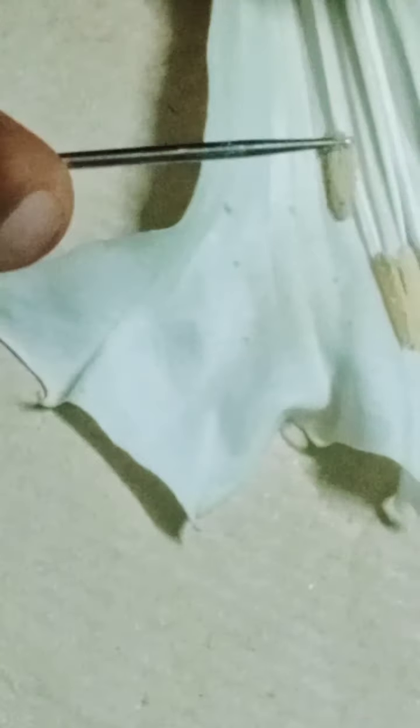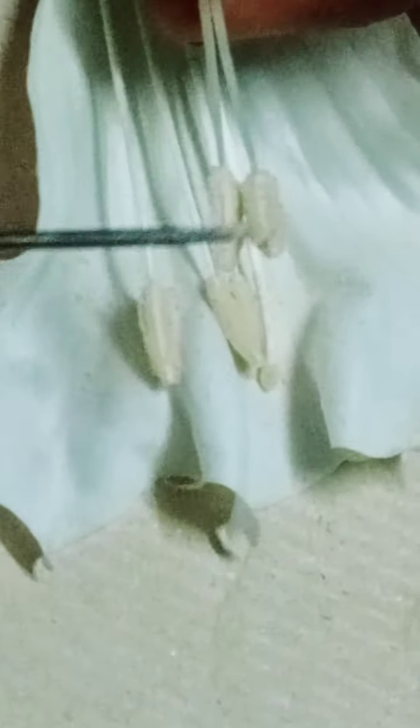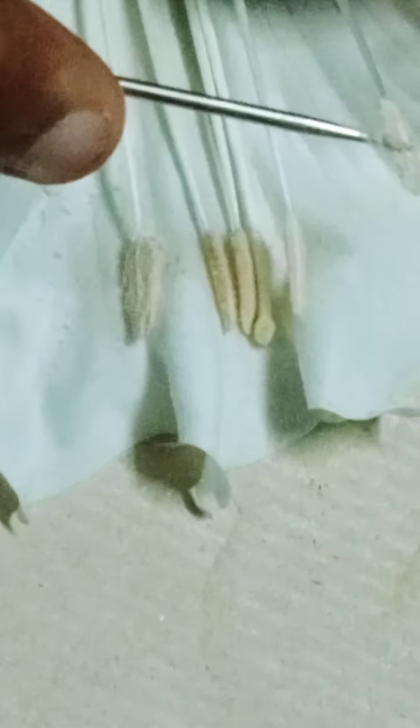If you touch the anther part, you can see a powdery substance — I am showing you. If you touch the anther, you can see the powdery substance. Is it clear to you? This is the pollen grain of the flower — you can see how the powdery substance appears. Yes, this is the pollen grain.